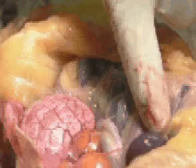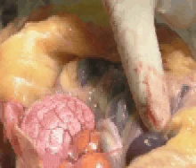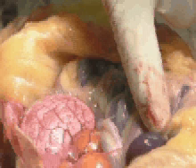To examine the remainder of the digestive organs, the gizzard can be grasped and by blunt dissection these soft tissues incised. As we reflect the gizzard, we immediately see this oval organ which is the spleen. The spleen is important in poultry because it's a site of many tumors and also can be a good organ to culture if septicemia is suspected, such as fowl cholera.